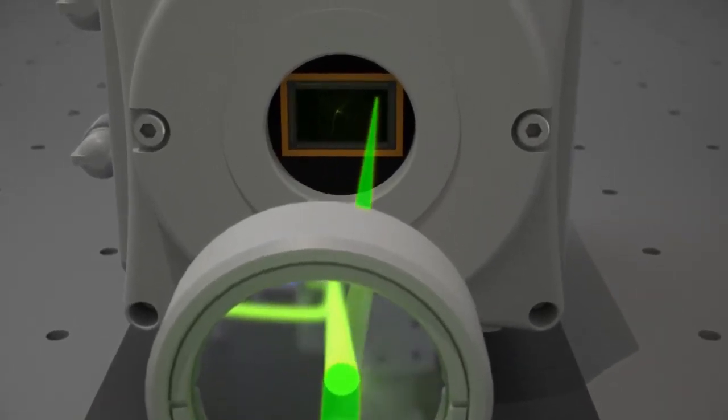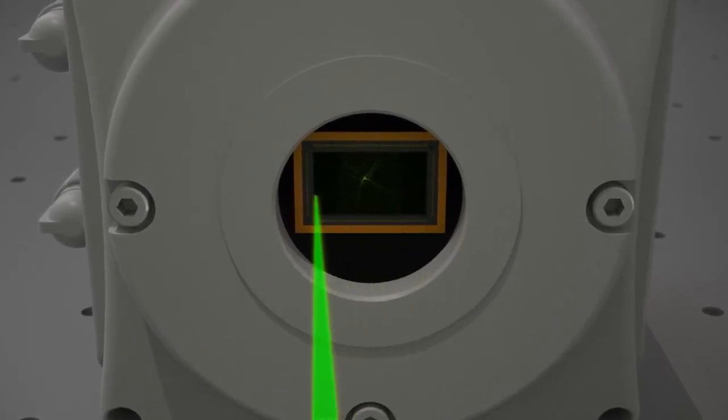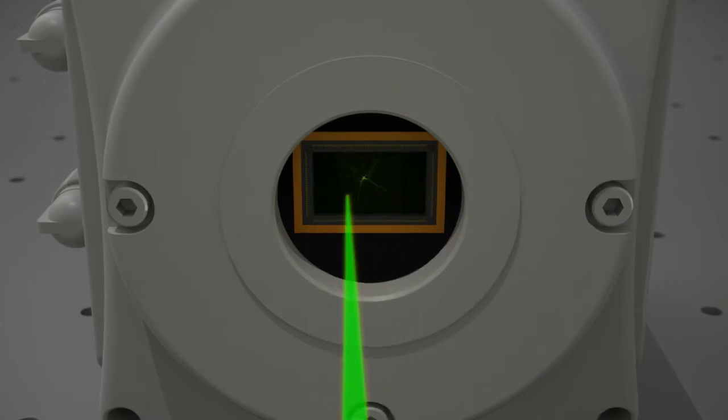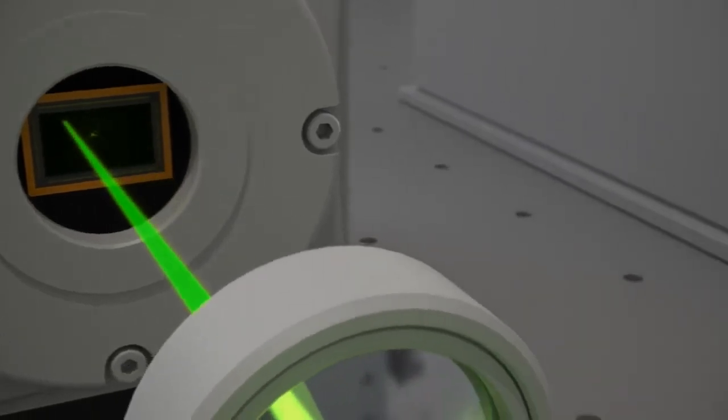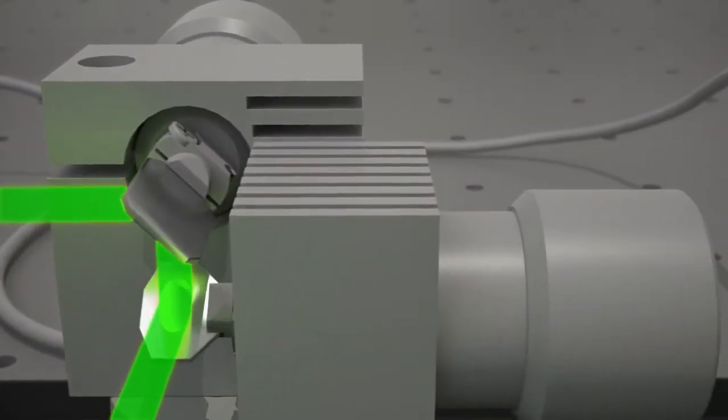Here, the image of the object is written point by point in a scanning manner. The image of the emitted fluorescent light appears in the camera and can be stored in the computer. By controlling the sweep of the rescanning mirrors, the resolution can be improved in the following way.